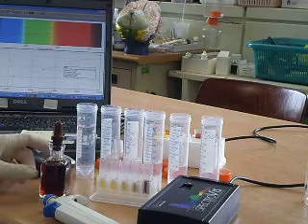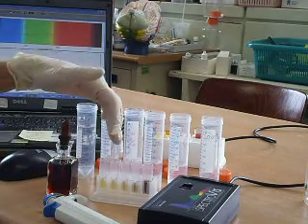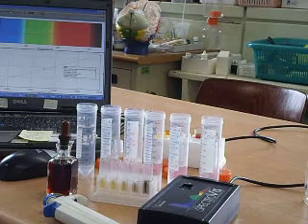It's an excellent way to quantify starch, and you can use it for enzyme studies, whereby we can add amylase, and the amylase will digest the starch, and the colour will fade away.